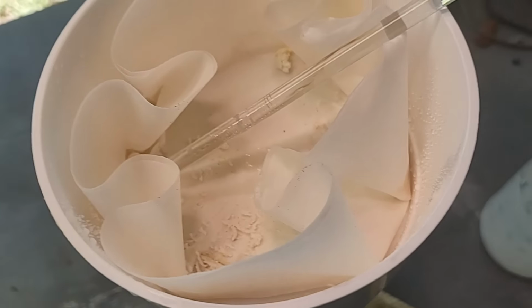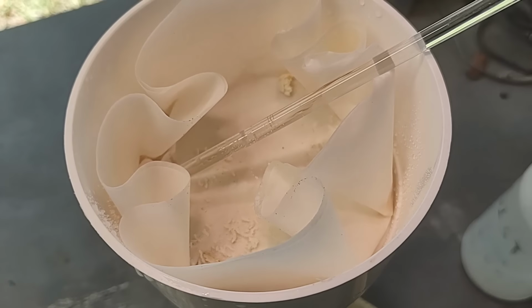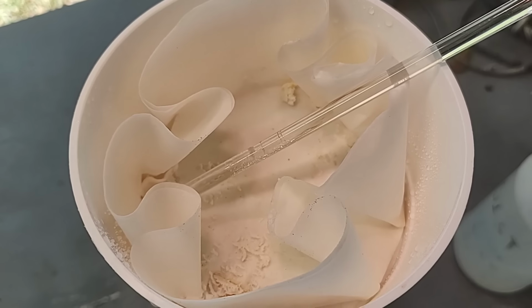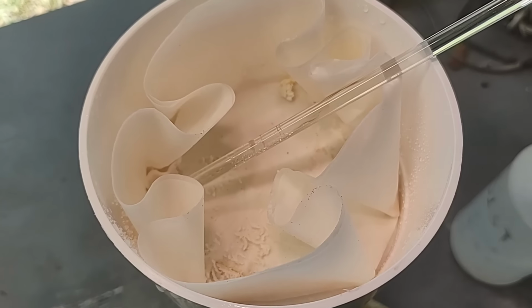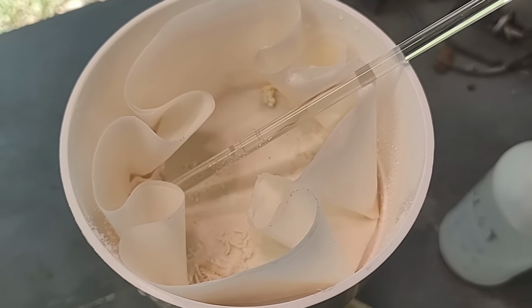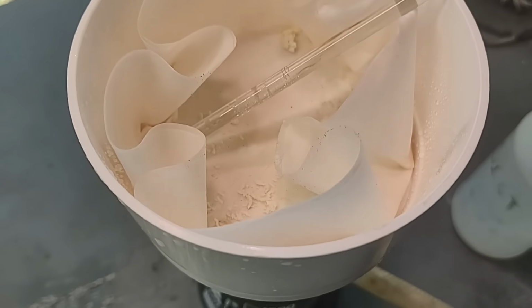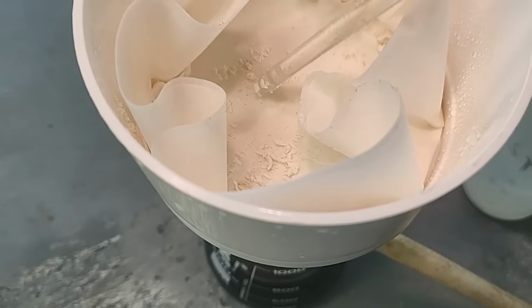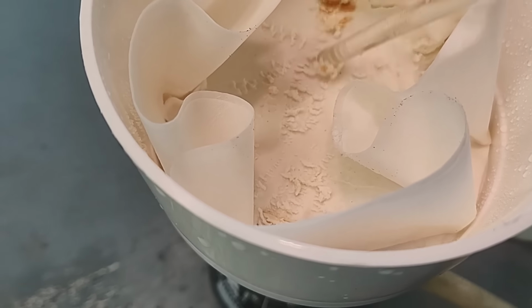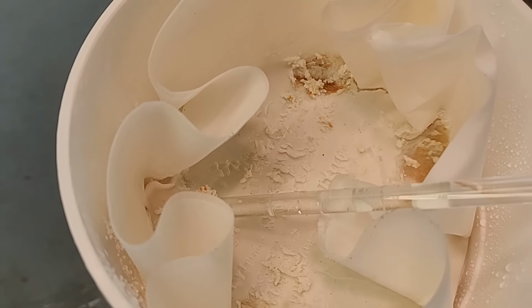So yeah, Joven, your strips might have a little bit of platinum in them, which is not surprising. The platinum group metals are notoriously difficult to fully separate from each other. So the palladium they used to plate those strips probably was a little contaminated with platinum. And I think I got some platinum up here in my filter. So yeah, there's more orange stuff over there. Definitely orange, not red.